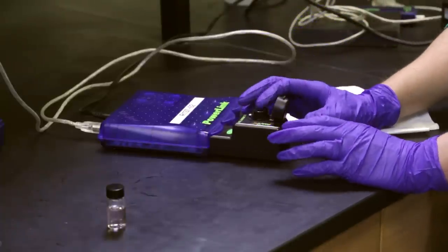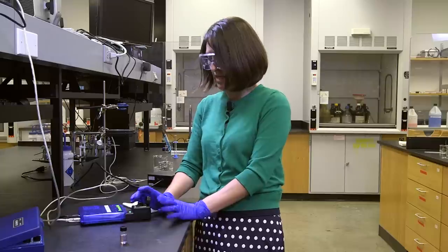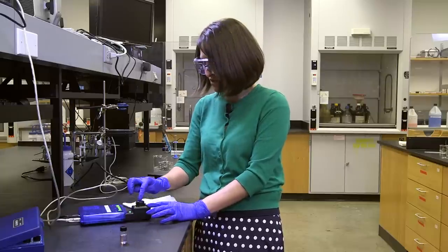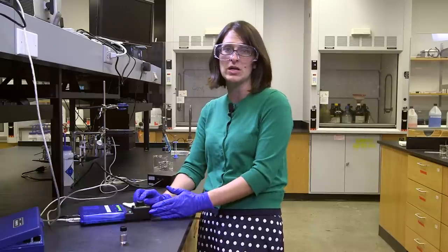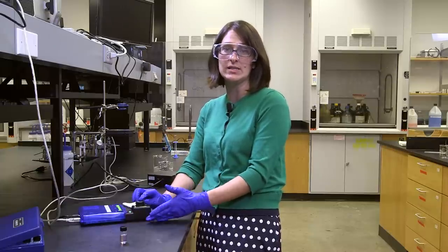So if I want to do a baseline sample, I have my calibration sample in the cuvette. I close the lid. It's important to close the lid because what we're doing here is we're measuring what light goes through, what light is absorbed.